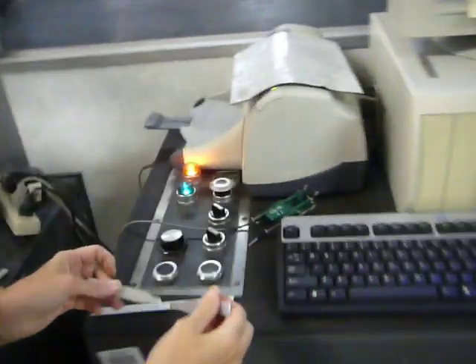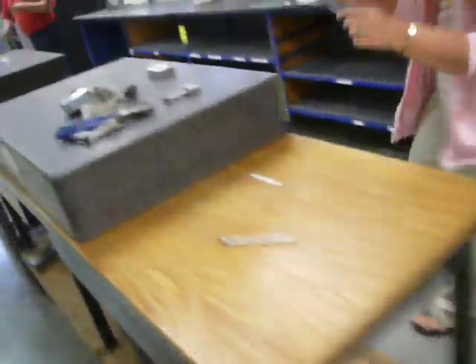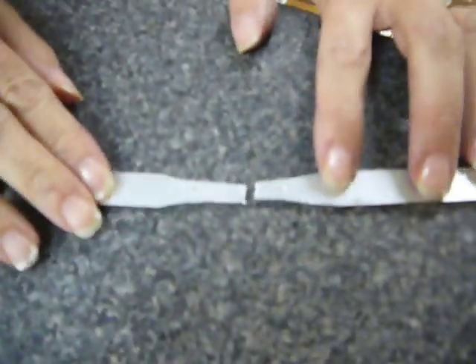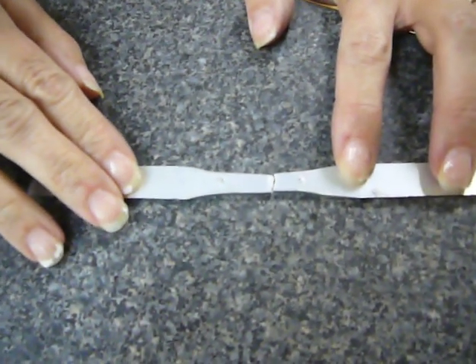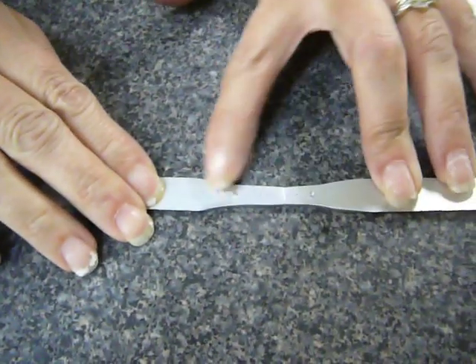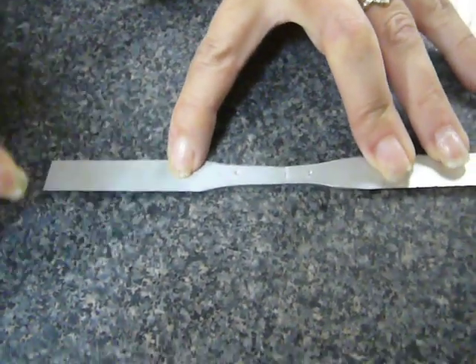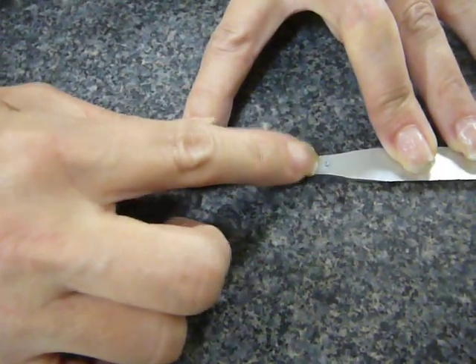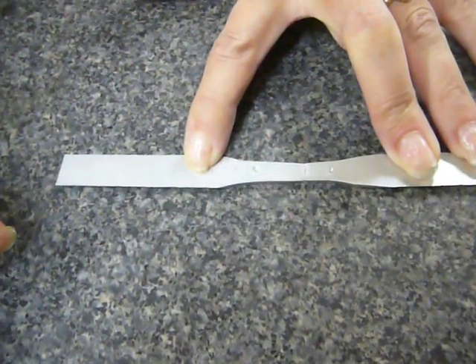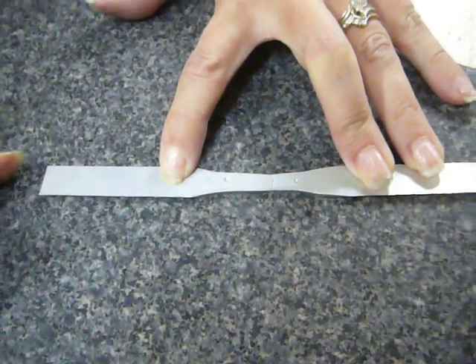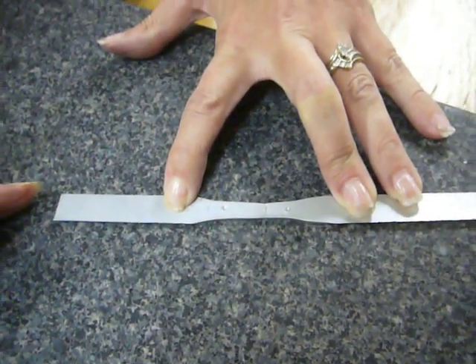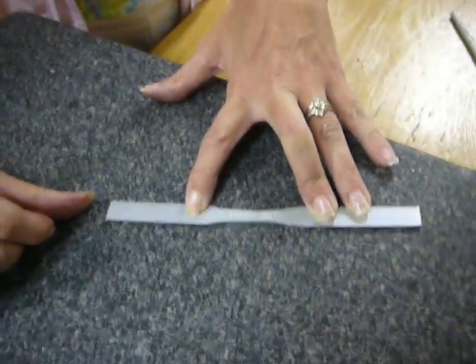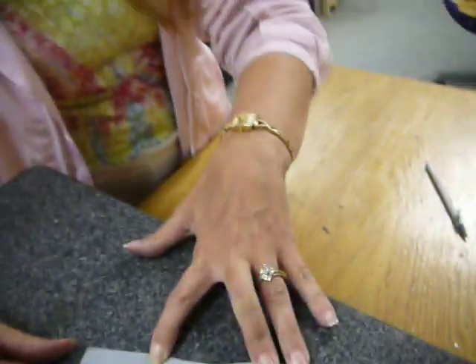And you put the two pieces together as best as you can on a flat surface. Let's go over here. And you measure between these two indentations how much it stretched before it broke. Okay, and that's all, but it's recorded in the computer here, right?